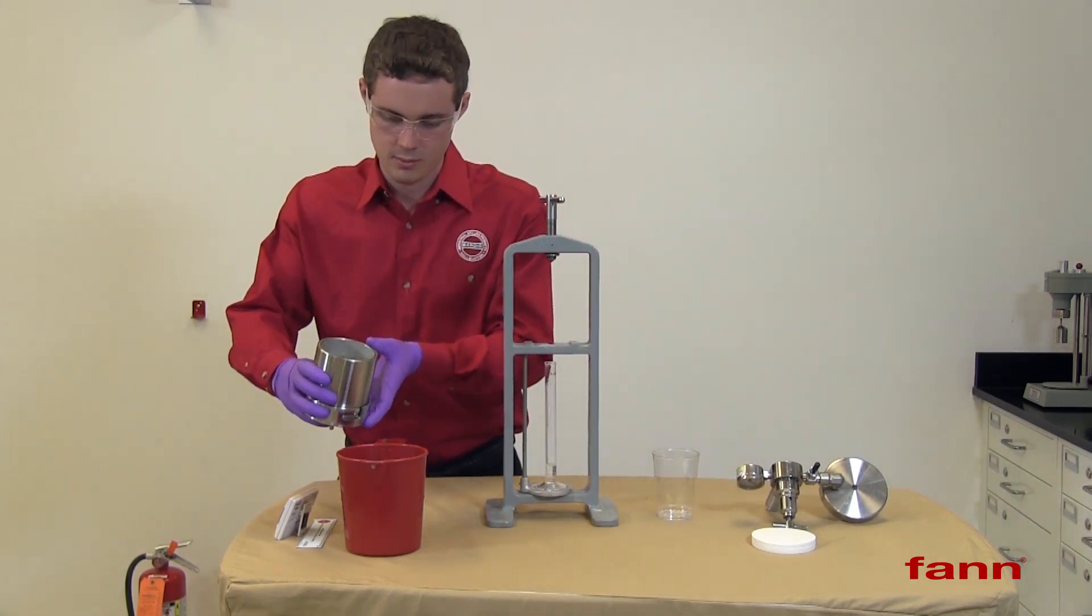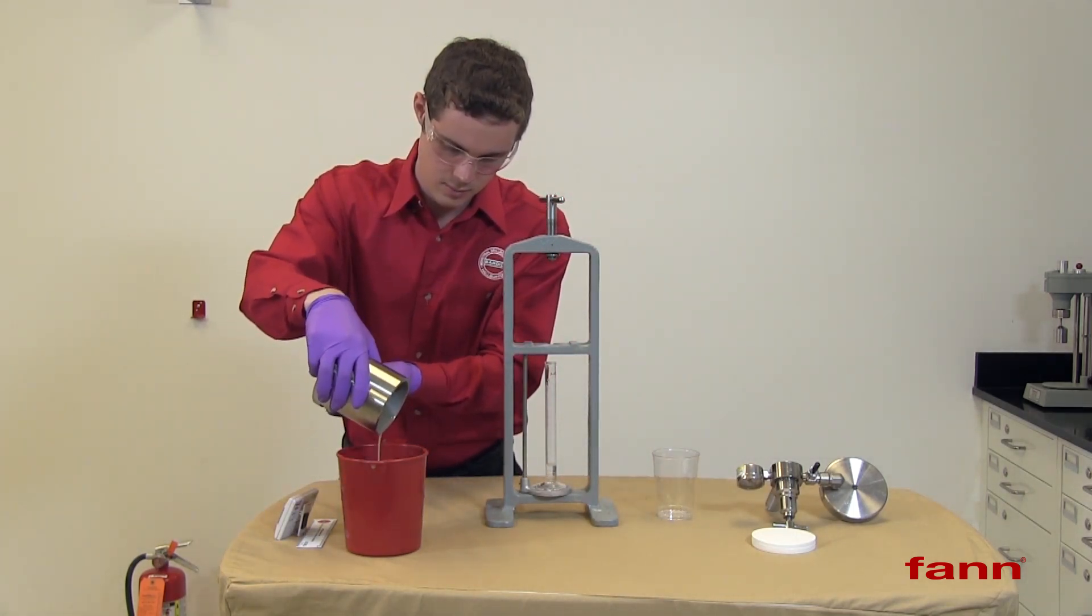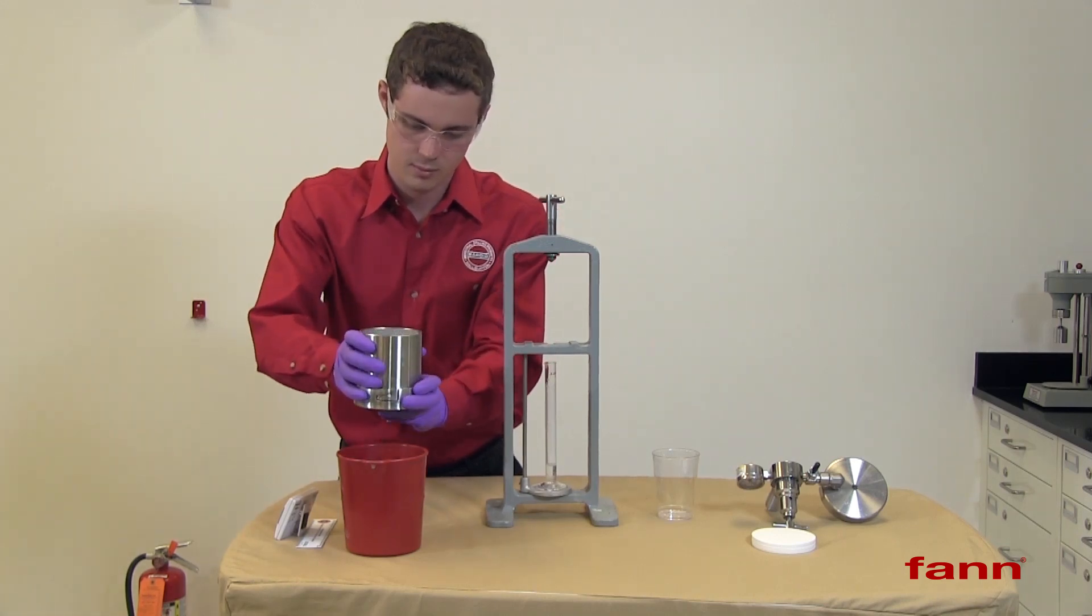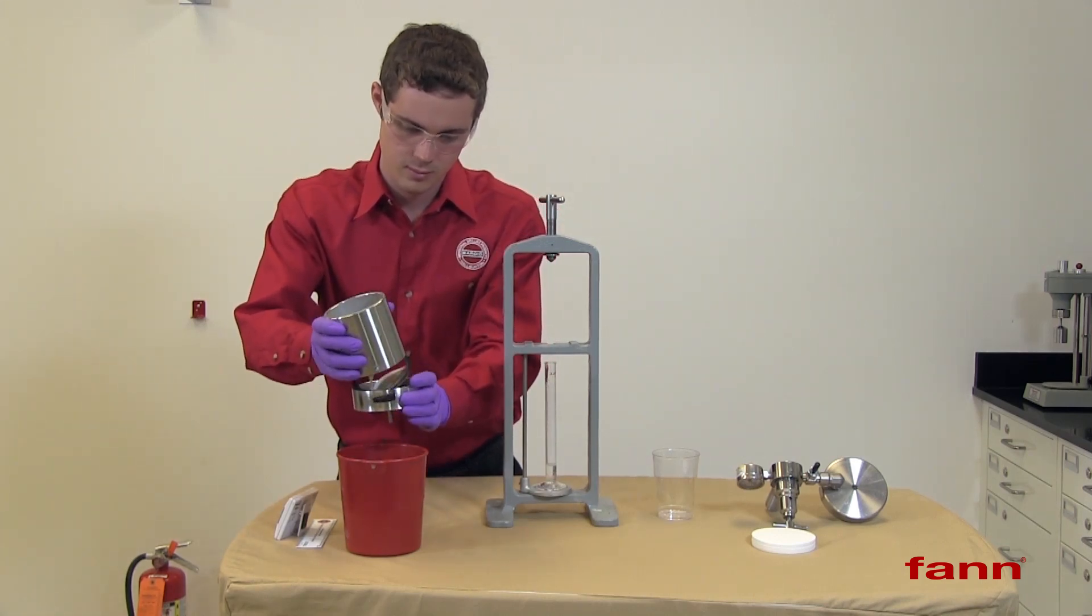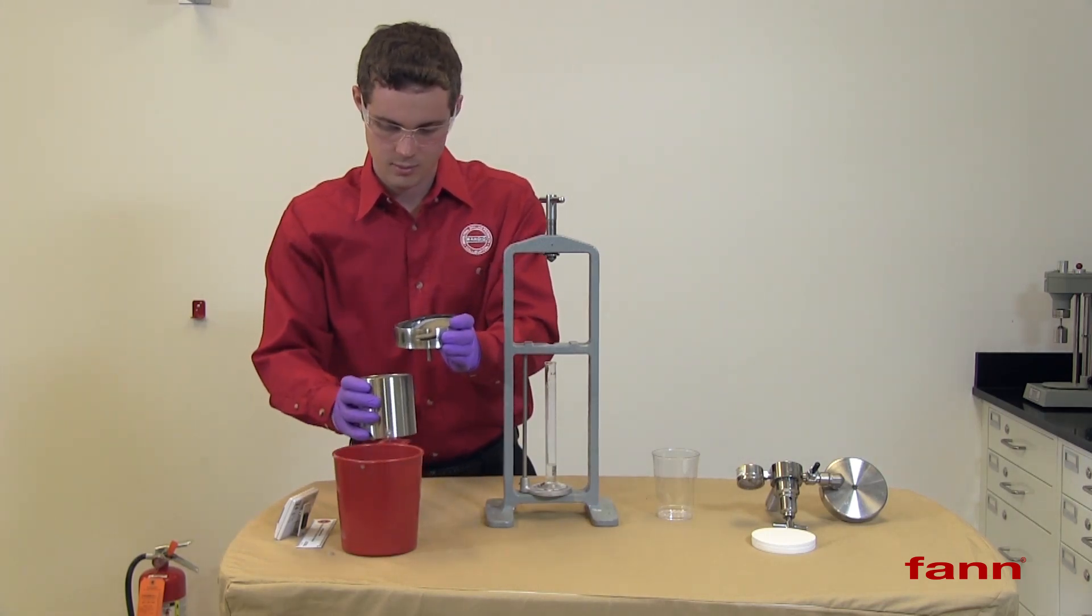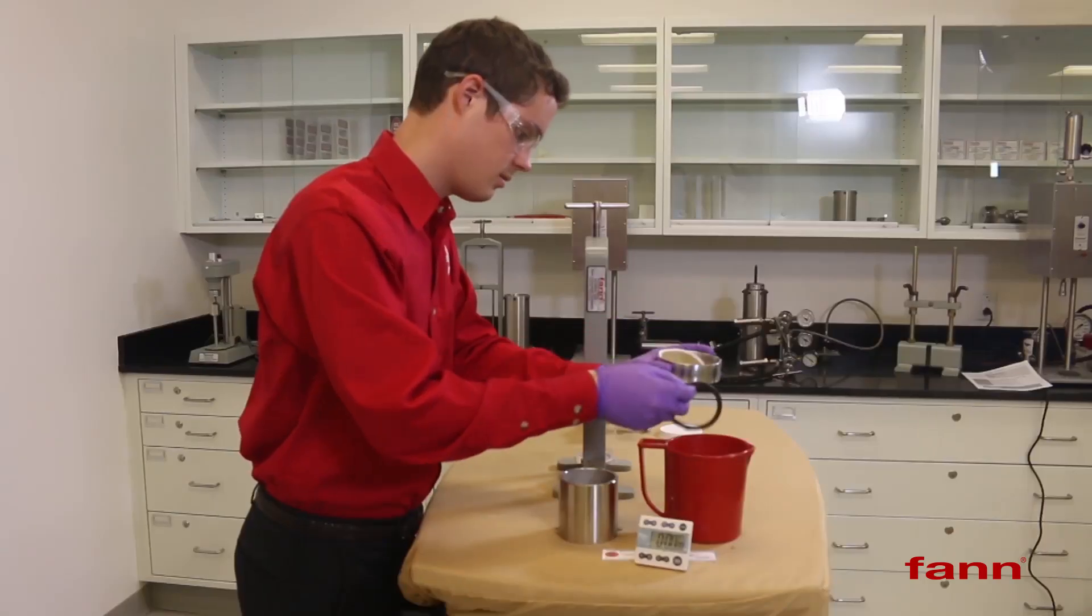Empty the cell. Take it apart and remove the filter paper.